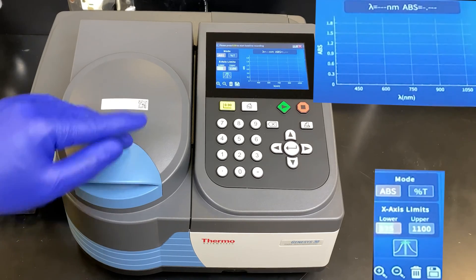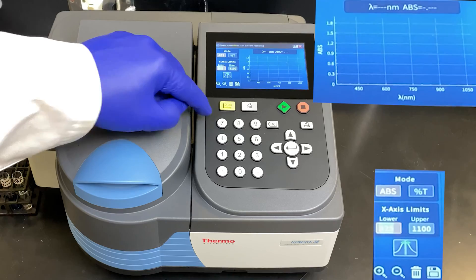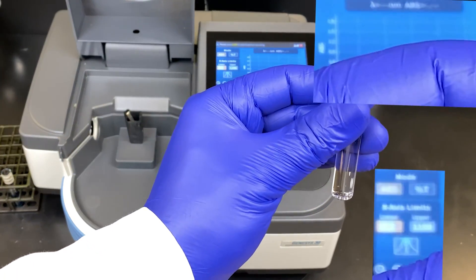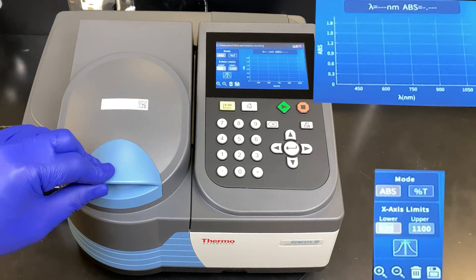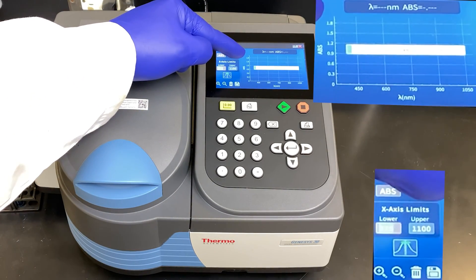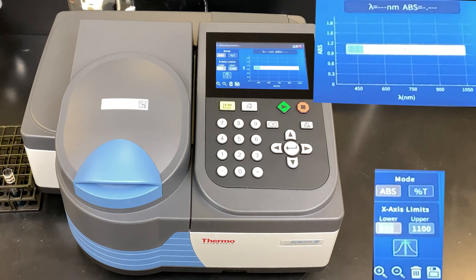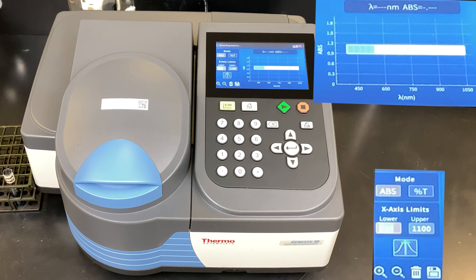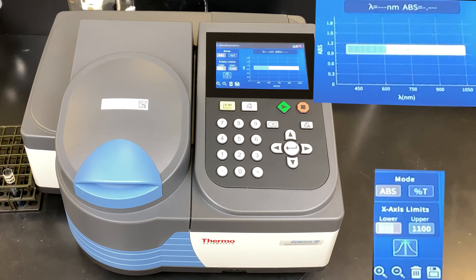Before we can start our scan, we must blank the machine. This button here is the blank button. We're going to open up the lid and place our water sample inside. Make sure there's no smudges on the glass. Close the lid and press this yellow blank button. It will now blank every wavelength from your lower to your upper limit. You can see the progress bar here — it doesn't take that long.